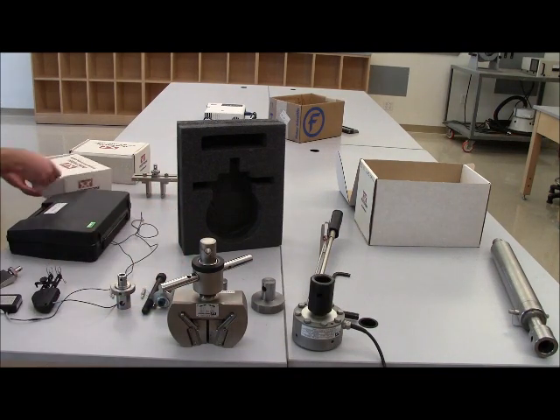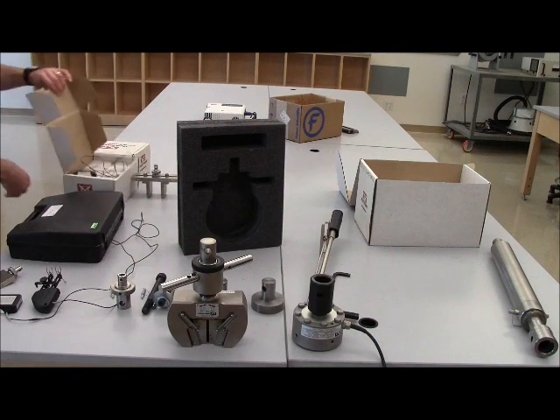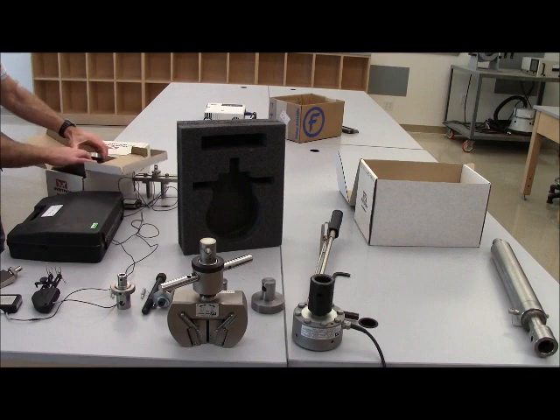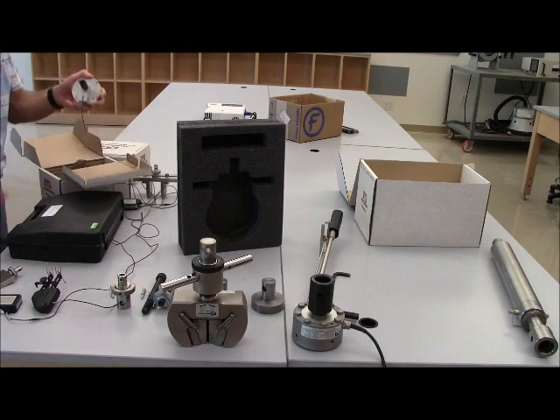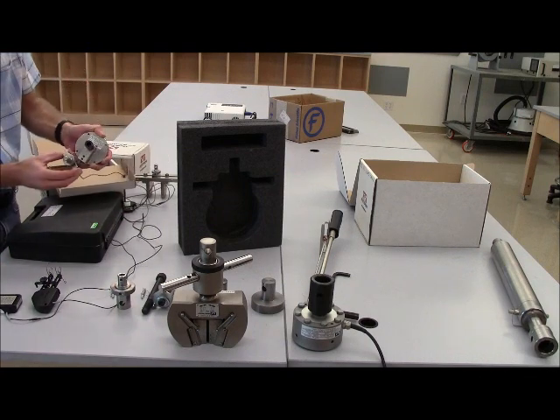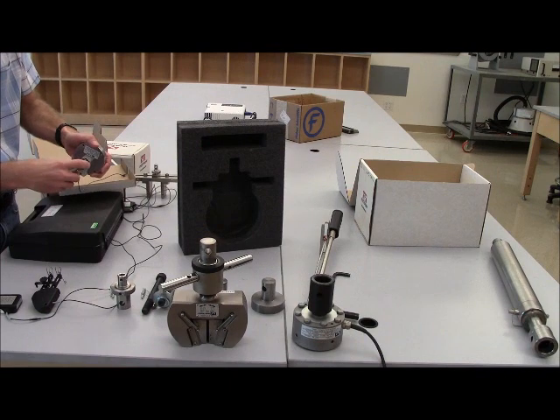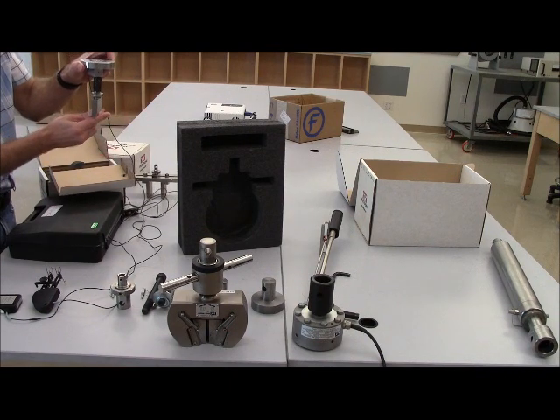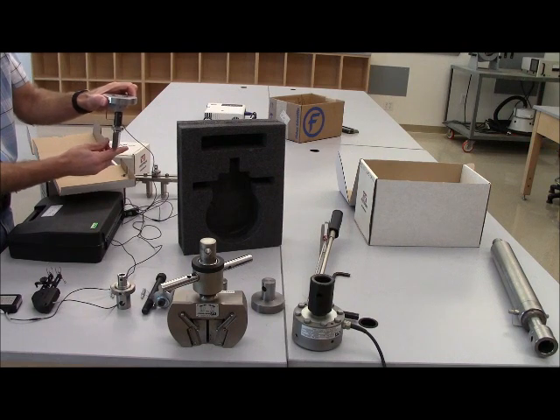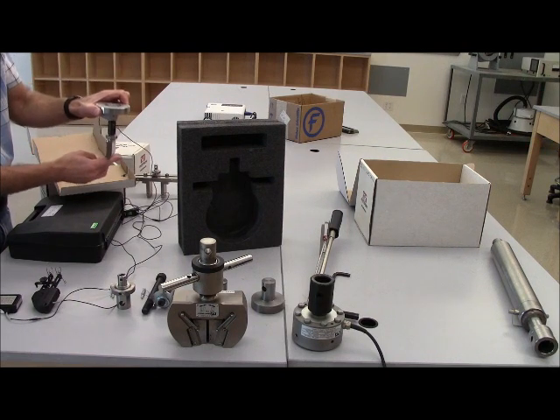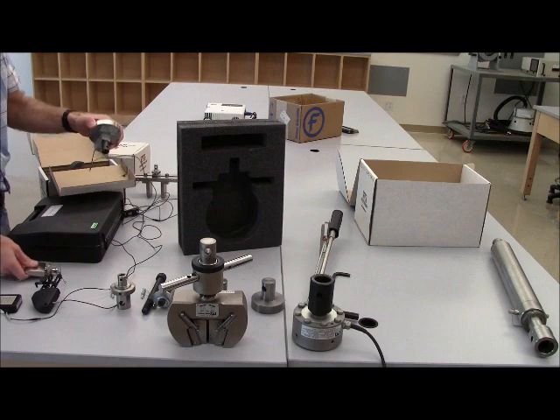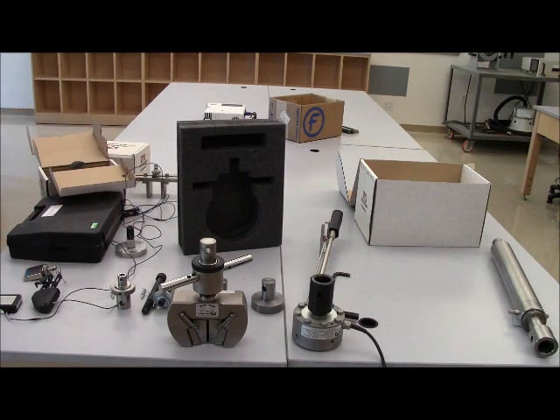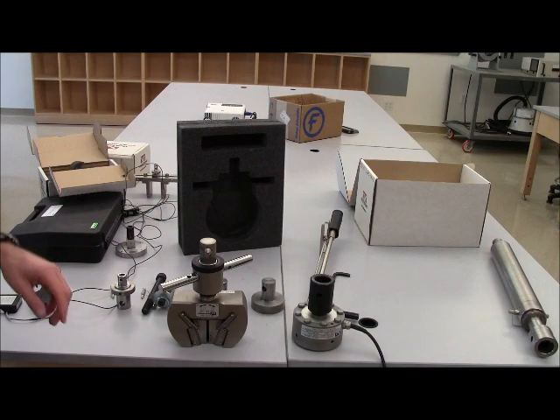The other type of interface is called the OM interface, and it is a much smaller interface with a much smaller pin. I believe it's a six millimeter pin that goes through instead of the half inch. Our smaller load cells have a type OM interface, and so as I get out this smaller load cell, I can show you that this OM interface fits in here. This attachment, by the way, is a knife edge attachment for three-point bend test. This would be the center force coming down. So again, DM and OM. I'll be using those terms as I explain the different components.